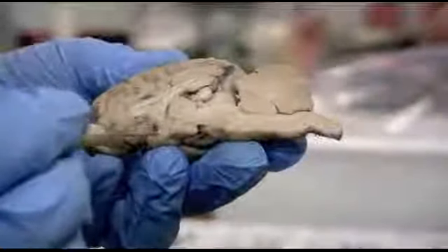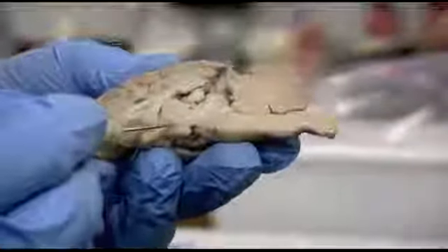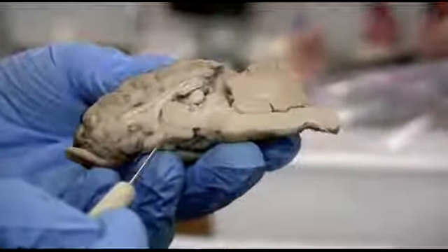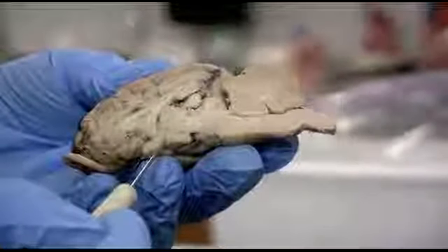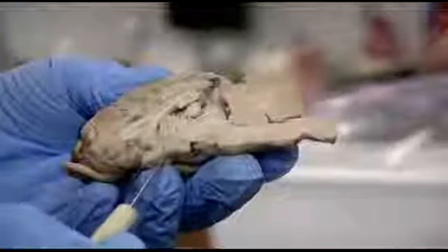This is the optic chiasm that was cut through. So this little region, the hypothalamus, is responsible for all sorts of functions, and it does produce a couple of hormones and stimulates other hormones to be produced or distributed from the pituitary gland. This is where the infundibulum would be, and the pituitary gland would hang down from that.